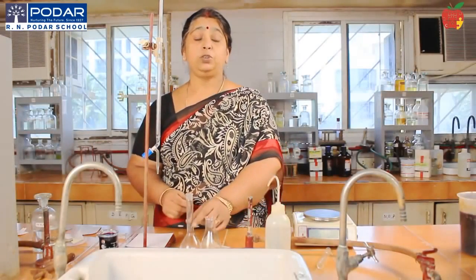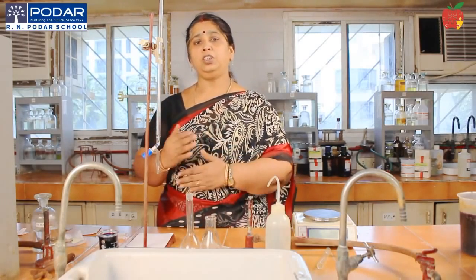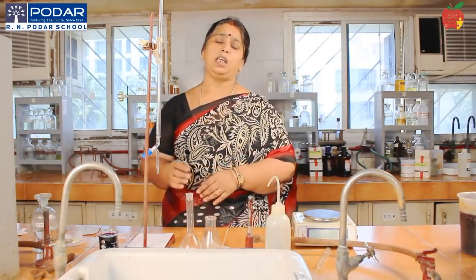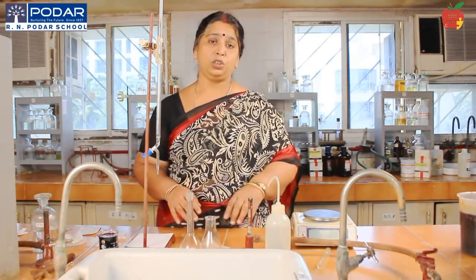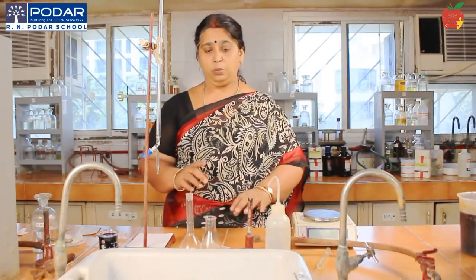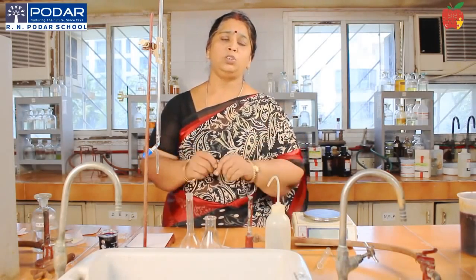I'll just demonstrate the preparation of Mohr's salt solution, and the titration of Mohr's salt solution with KMnO4 to find the molarity and strength of the KMnO4 solution. You are supposed to prepare 1/10 molar Mohr's salt solution, right? So we have calculated how much you should take.